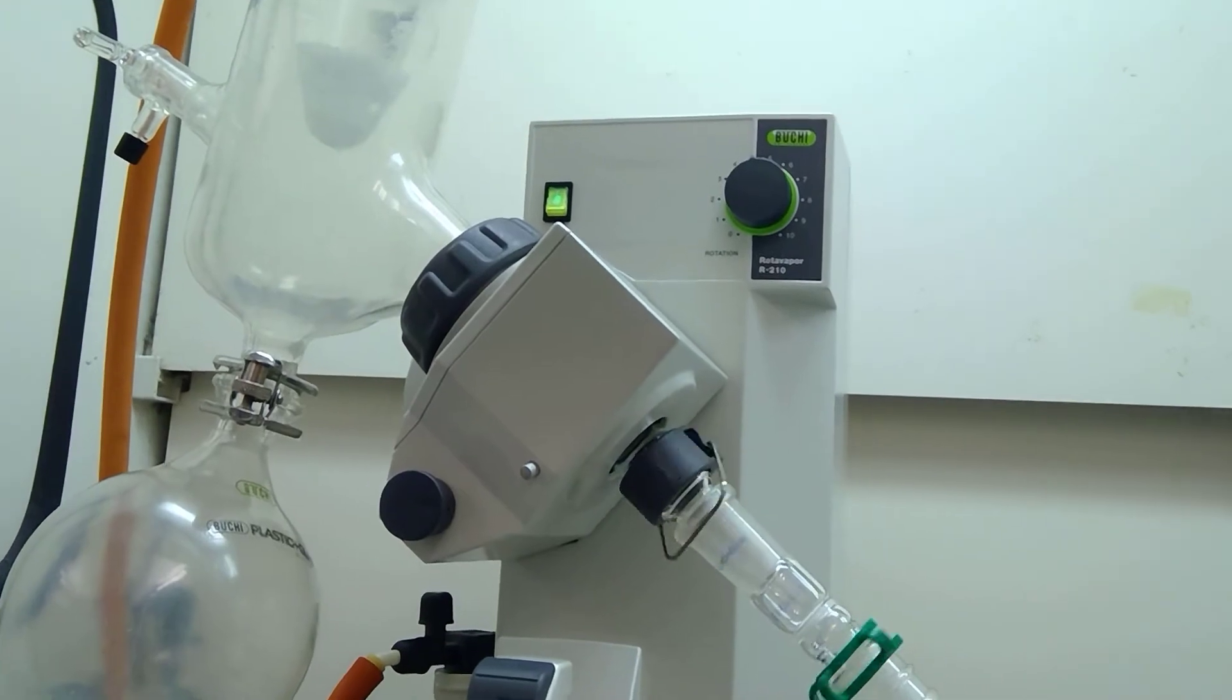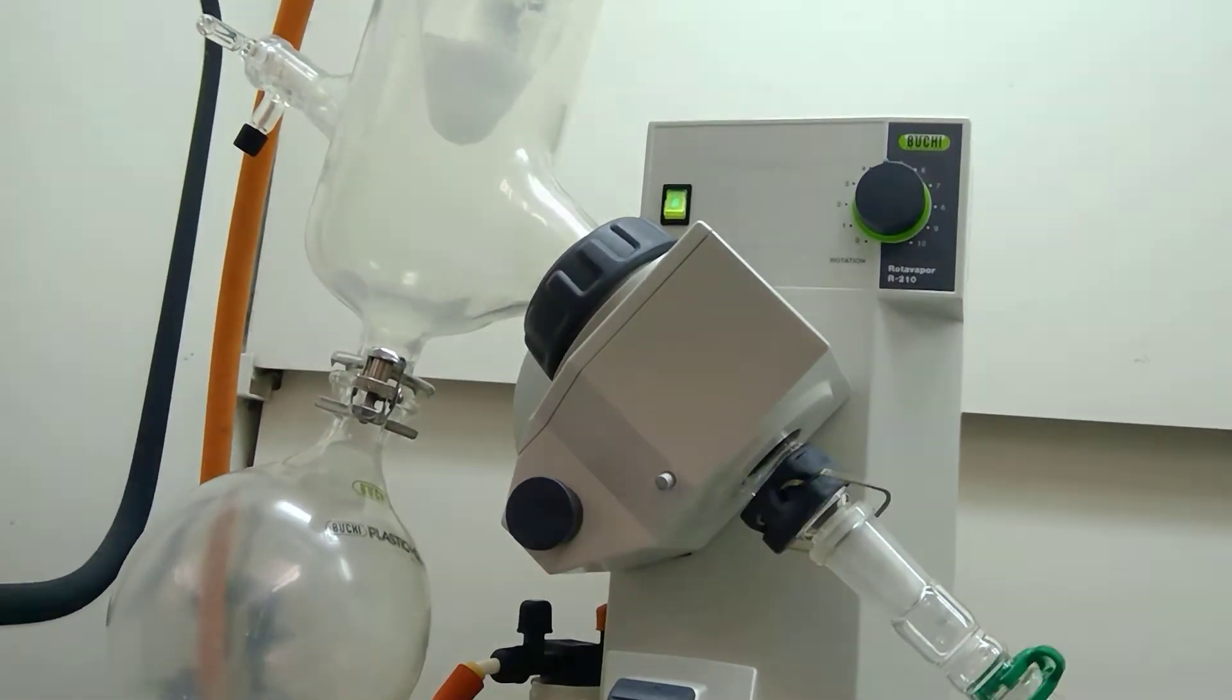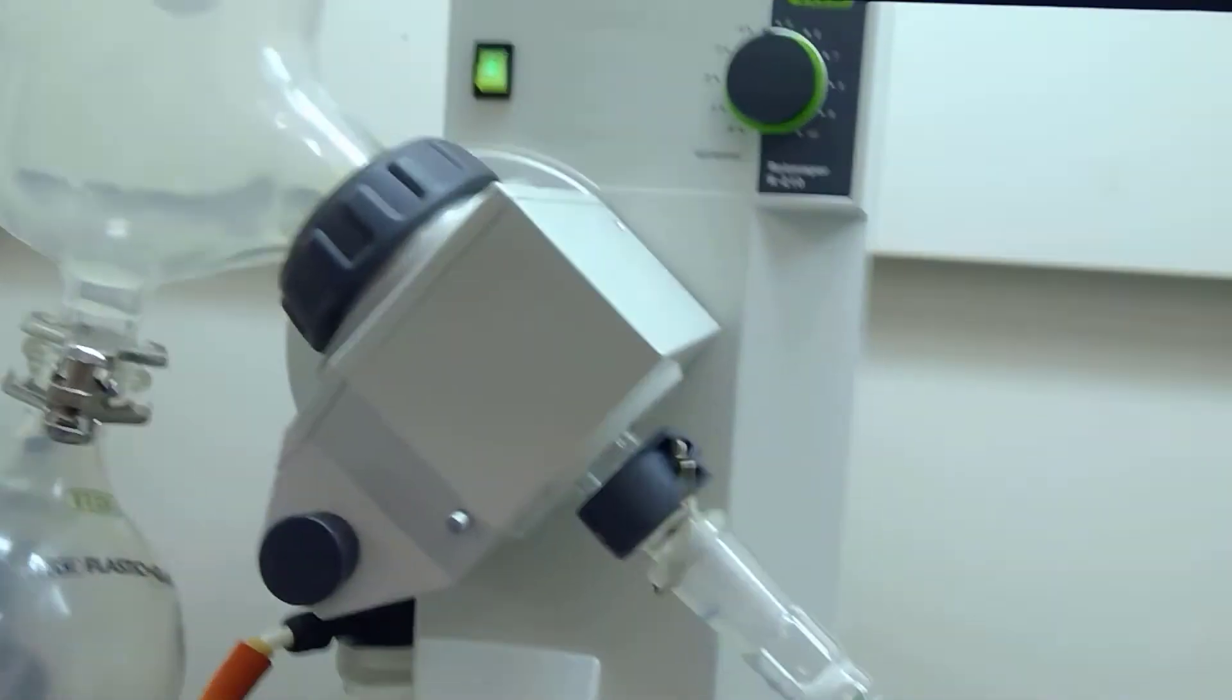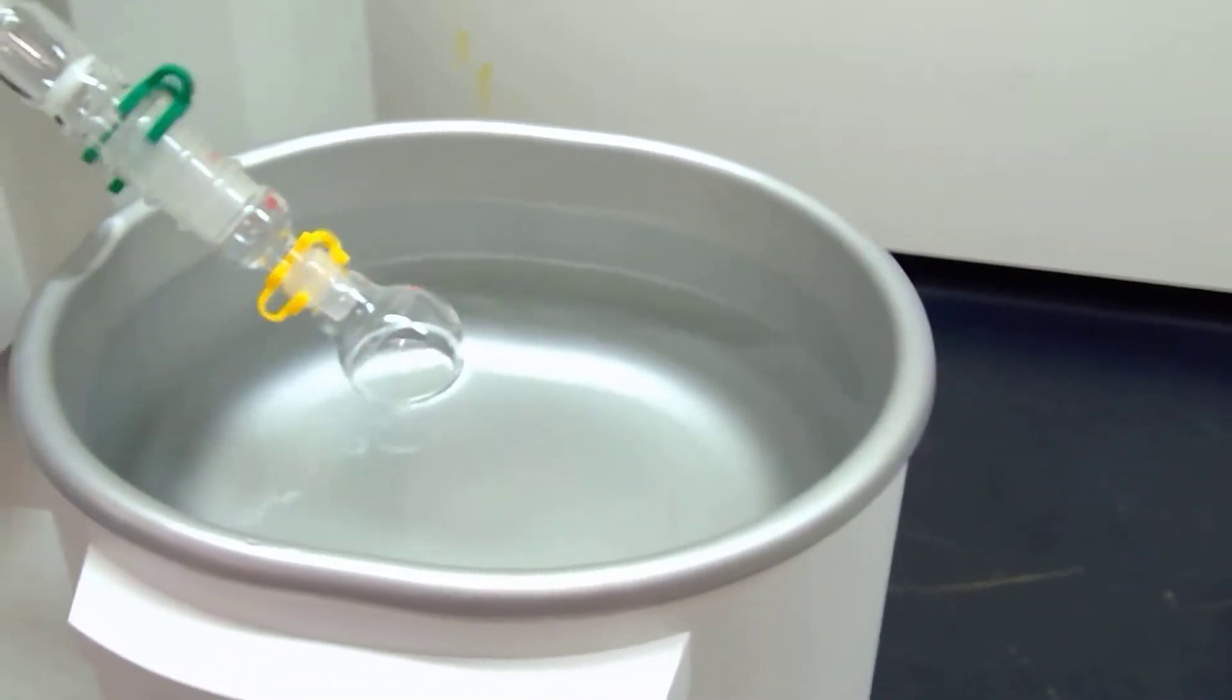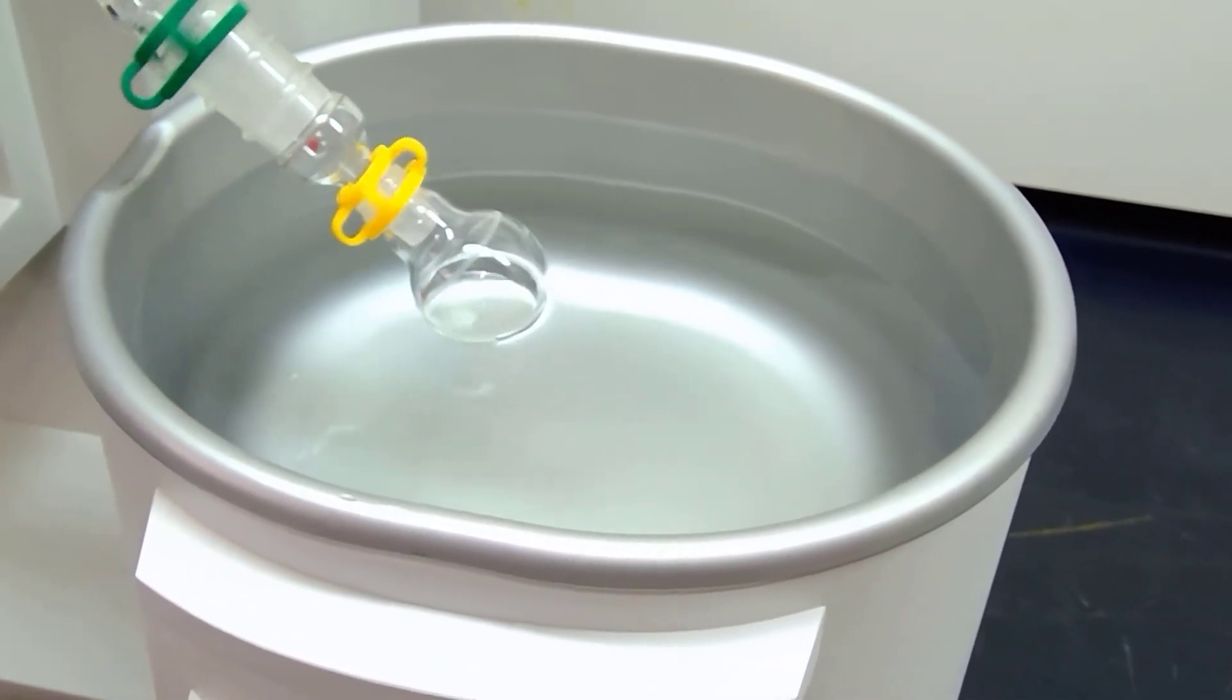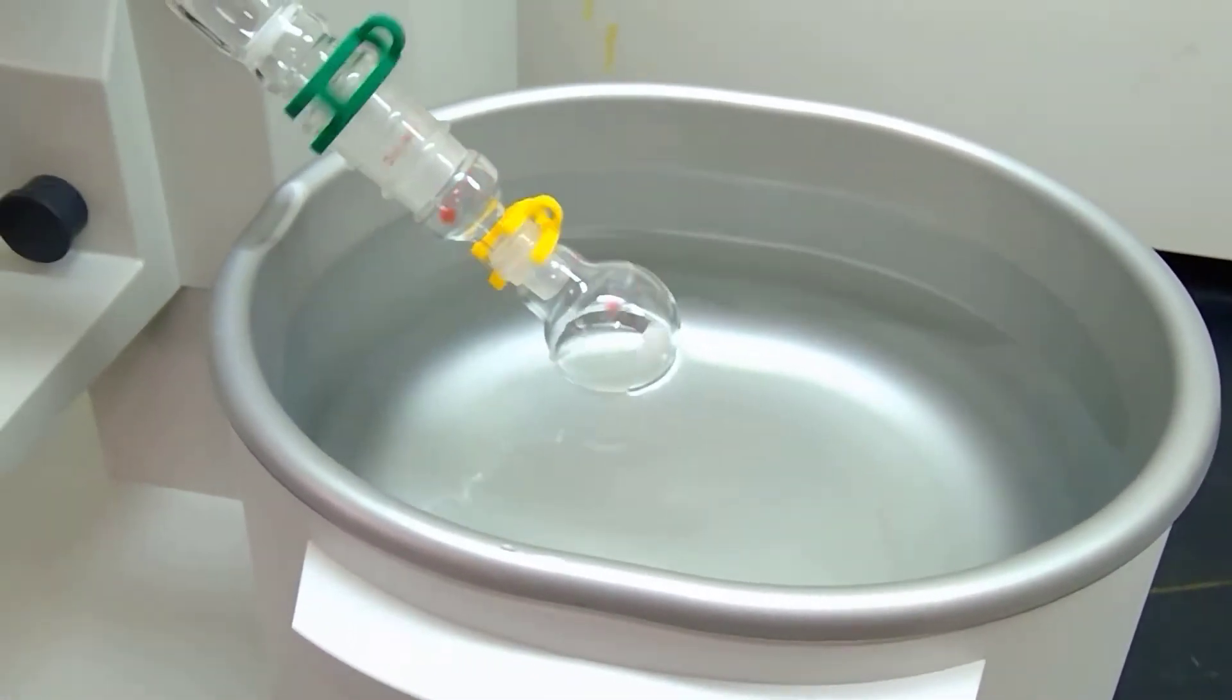There we go. The solvent being evaporated is tert-butyl methyl ether, and although it is an ether, it is a heavier ether, so it might take a little bit for all of it to evaporate.